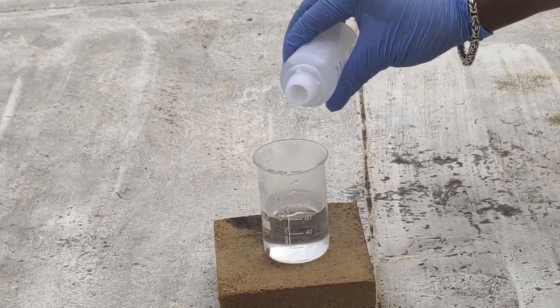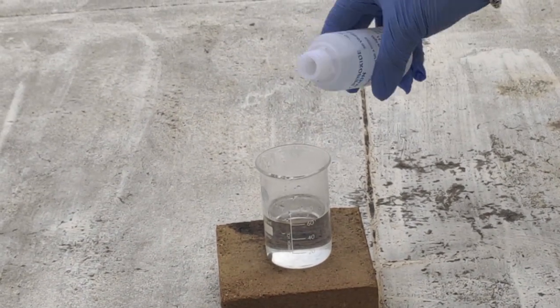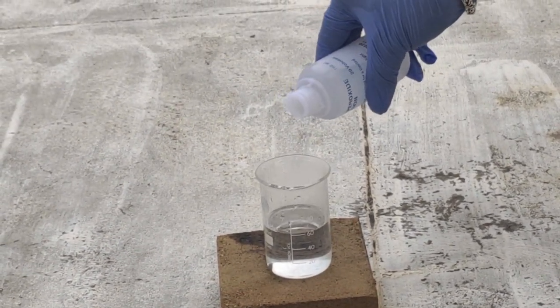So this is the exothermic reaction. This is the Piranha Solution. In the Piranha Solution, Organic Contaminants Dissolve.